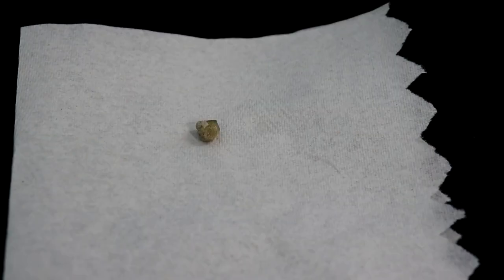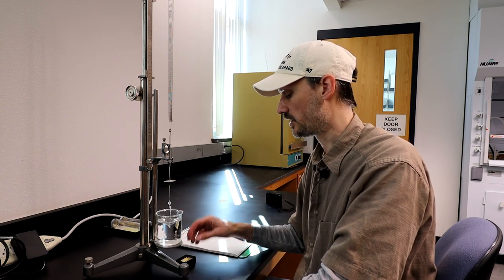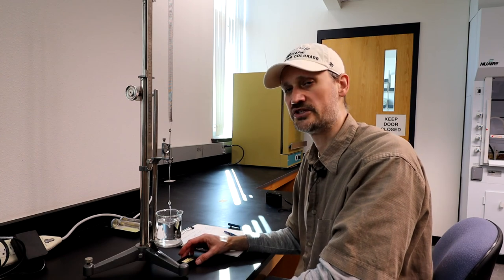Sample out to dry, and repeat until you have about ten samples that you've measured. More the better—you can get twelve—and the better results you're going to get. That's the basic operation of collecting specific gravity data for small samples with a Jolly Balance.